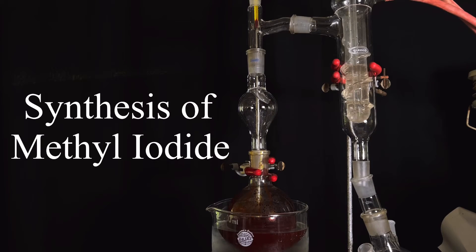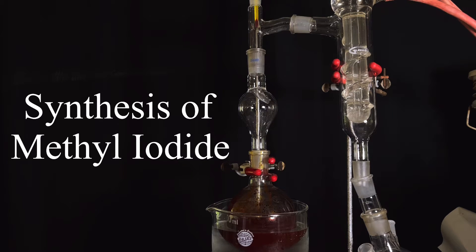Hello friends, in this video we will be synthesizing an important methylating agent in organic chemistry, methyl iodide.